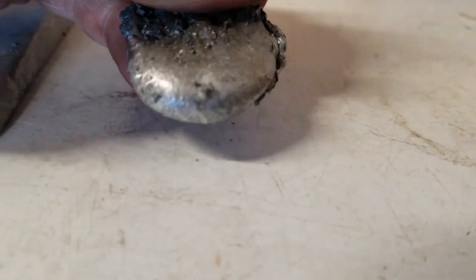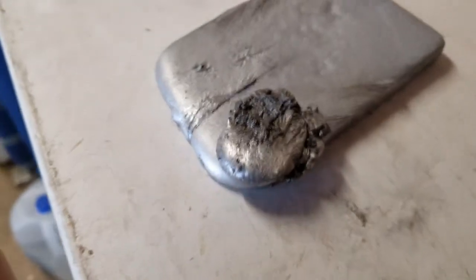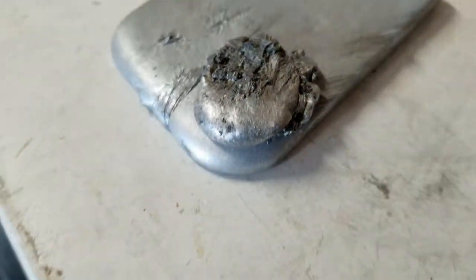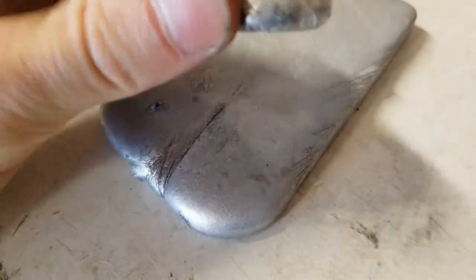This is what came out — something that's just a little bit darker than my regular ingot. As you can see they look pretty much the same, but this one is noticeably darker, especially when you look at it at an angle. There's some slag on top so it isn't a great sample, but I'm thinking if only one of these contains calcium, it's probably this one. Another encouraging sign is the slightly yellowish oxides building up right here — it's just a real thin layer, but that might be something good.